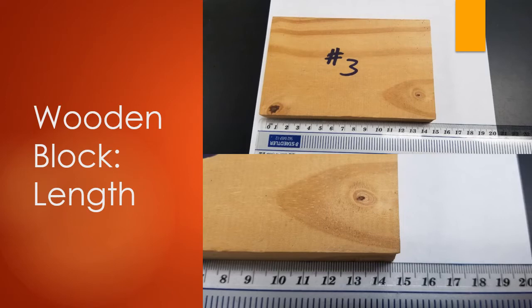Now, looking at this ruler, you can see that it measures to the 10th spot. Each one of these dashes is worth 0.1. So we have 11.1, 11.2, 11.3, 11.4, 11.5, so on and so forth. Okay, so you don't want to stop at the 10th spot when you're taking this measurement. You want to go one further.